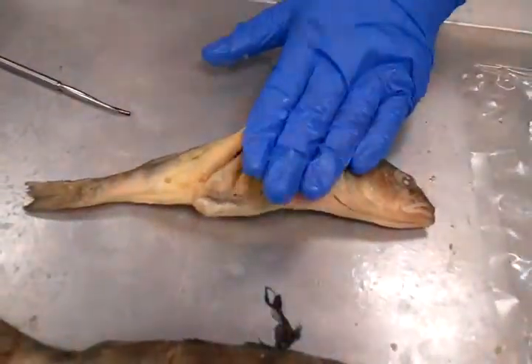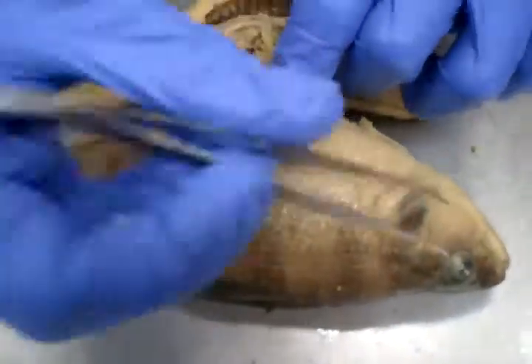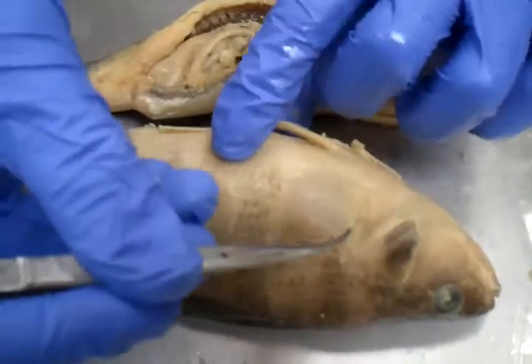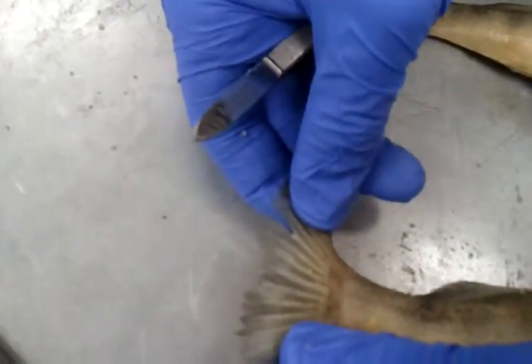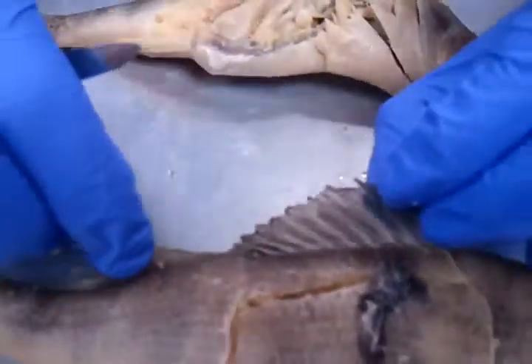And don't forget your fins and all that stuff. Let's go over the fins one more time. I have to flip this, so let's take a look at the fins. This is the pectoral fin. Remember, it got cut off on this side. Then we have the pelvic fins here, the anal fin, and the caudal fin, which is of the truncate type. And then moving back to the dorsal fins, we have the spiny and then the soft.